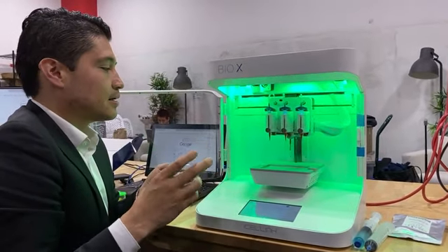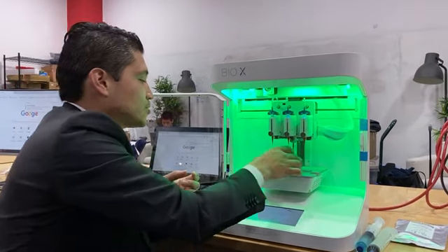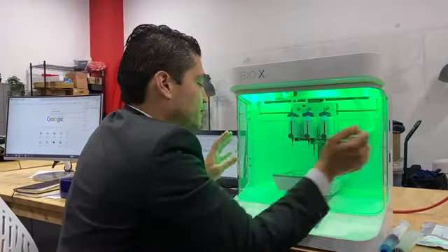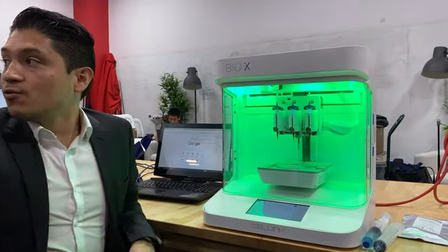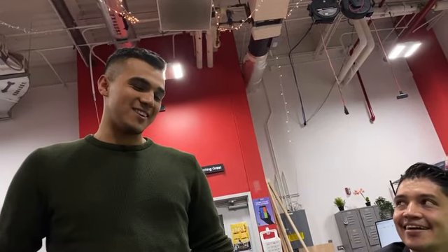Yeah. Let's print a nozzle, right? So I'm gonna print the nozzle on the top of that, right? So I would like to ask Melvin here to print the nozzle. He has been working with this bioprinter in his lab because you want to study what? I want to be a mechanical. I'm going to be an electrical mechanical engineer.